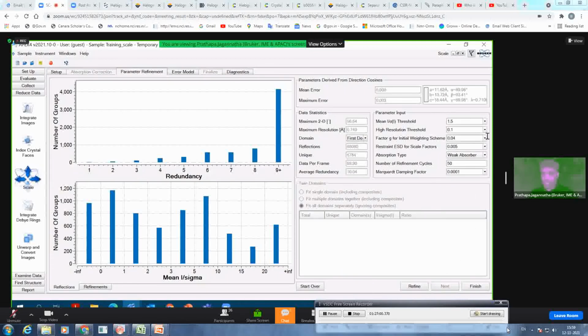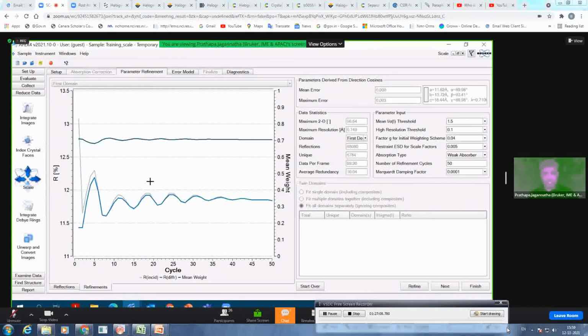I can see now everything looks fine. I just refine. Once I refine, I can see that the scaling is not at all smooth. It converges, diverges, converges, diverges, and my mean weight is also very poor. So in this case, I need to tweak certain parameters. For example, I know this is a metal complex, so I use strong absorber, and I can see there is a peak absorption effect. I also try considering the restraint ESD for scale factors. So I go slightly higher, for example 0.01, and repeat the refinement.